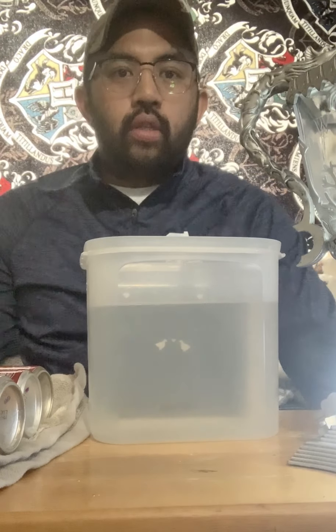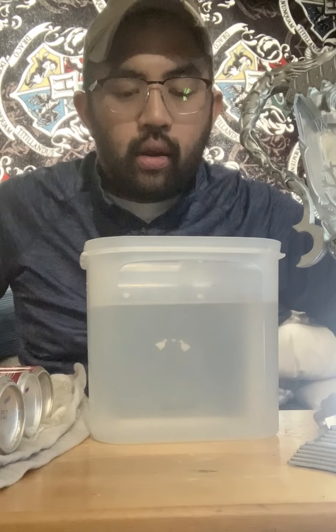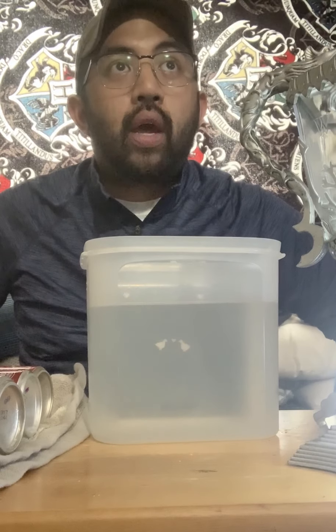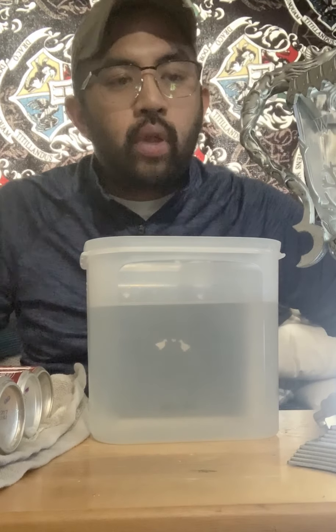So this video is a demonstration for one of the topics we discussed in the lecture about percentages, the types of percentages, the mass to mass, volume to volume, mass to volume, etc. Well, I guess those three.